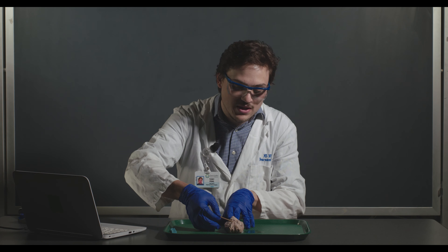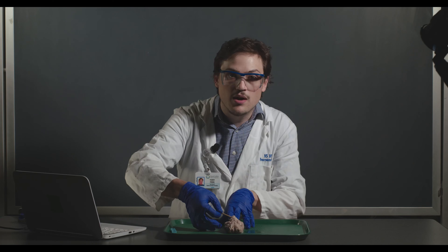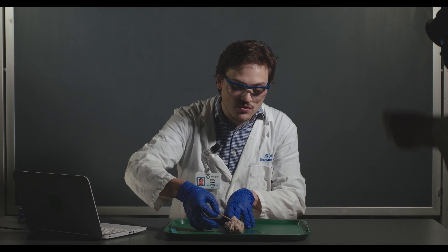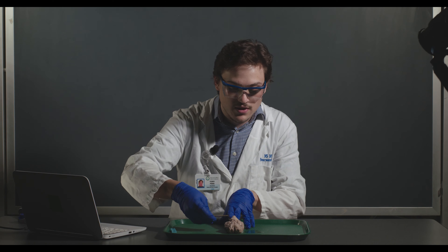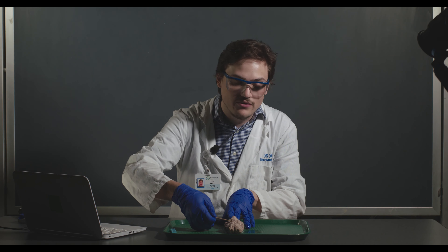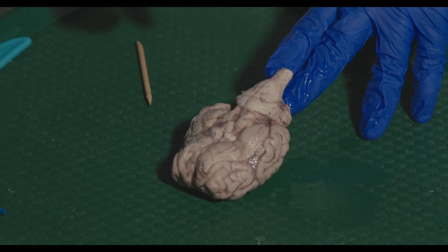You also lose part of the optic chiasm, which is kind of ripped here. The optic nerve actually comes through the dura mater, so when they pull it off, the nerve comes off too. Most sheep brains in these labs essentially don't have the pituitary or intact optic chiasm, so just keep that in mind.